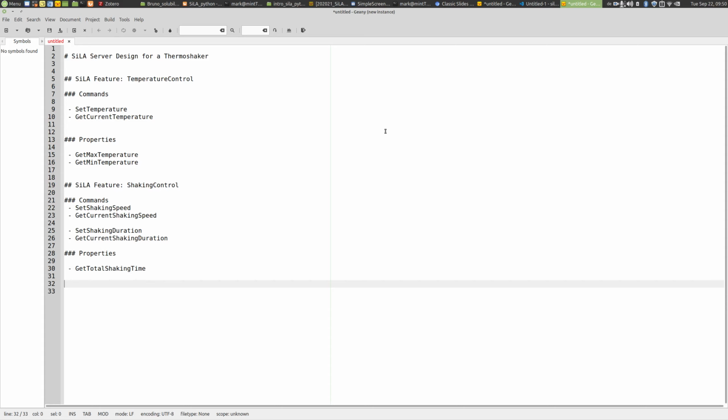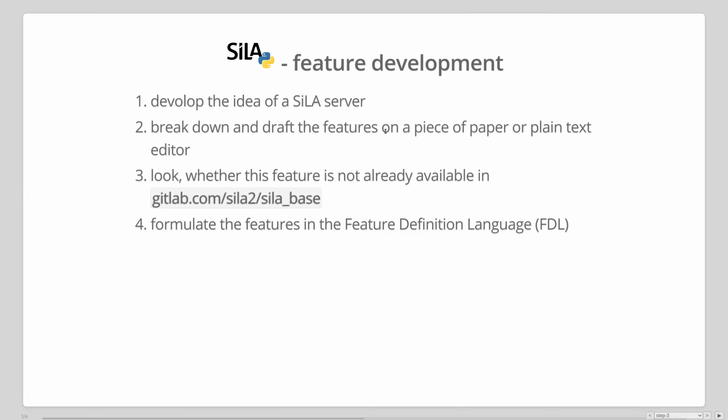And additionally, you could specify foreseeable errors. So you could already think about error handling. So one error could be shaking speed out of range error. Yeah, so this is good enough as an example. And now let's go back to the next steps.